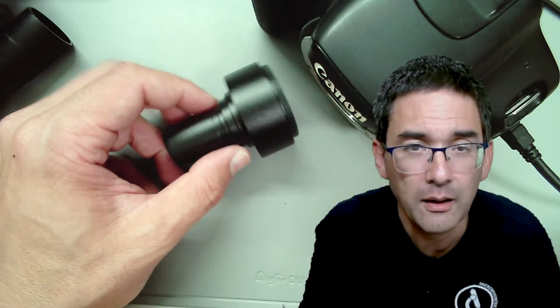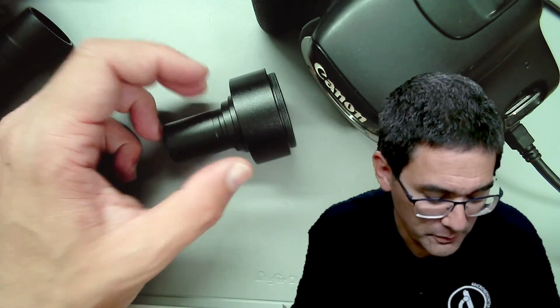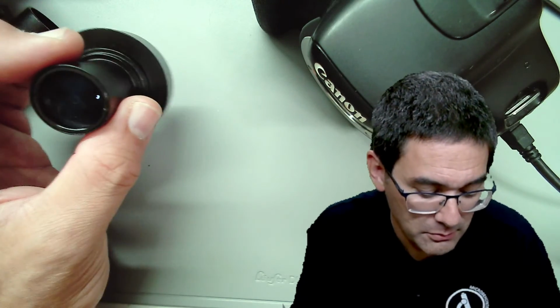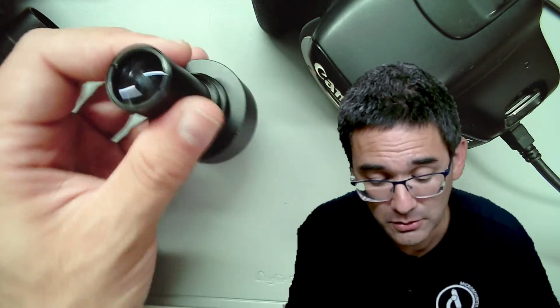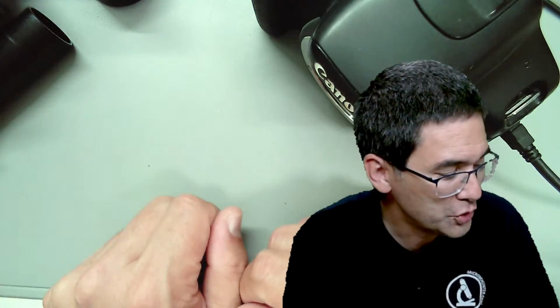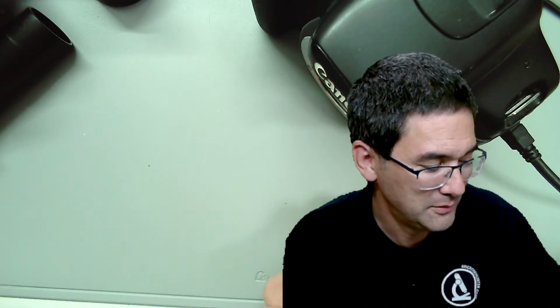I got this over AliExpress, directly imported from China. It took ages to come, but it was cheaper. And yes, it works. So if you already have a DSLR, I would say that this is probably the first thing that I would try.